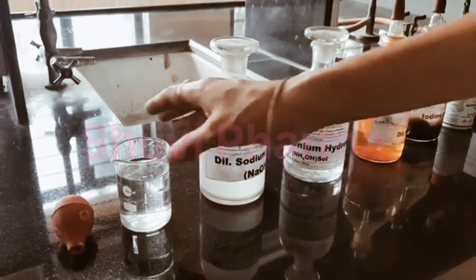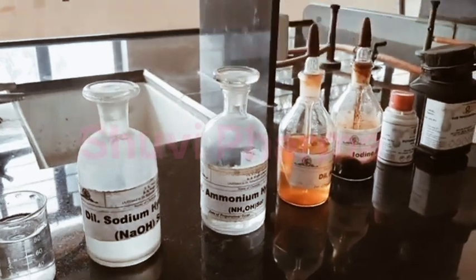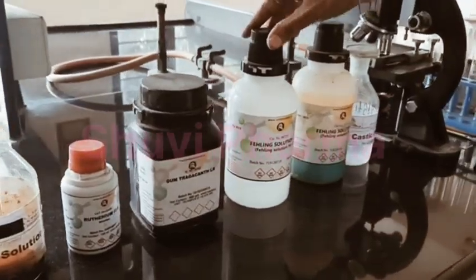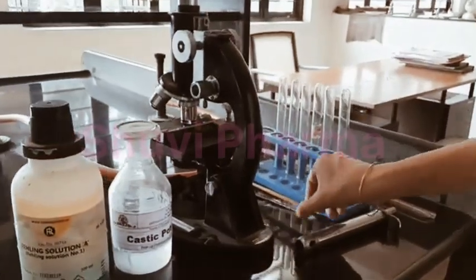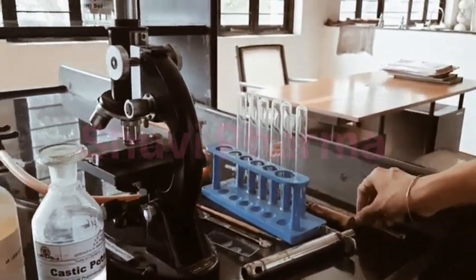Requirements for the practical: we require water, dilute sodium hydroxide solution, ammonium hydroxide solution, dilute HCl, iodine solution, ruthenium red, the powder that is gum tragacanth, Fehling's solution B, Fehling's solution A and caustic potash. A microscope is also required as an apparatus. Then slide, spatula, brush, some test tube holders and pipettes.